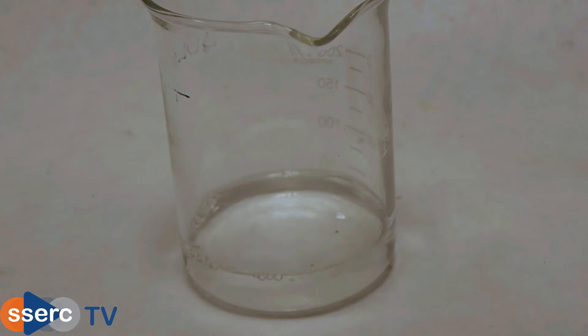Now add 8 grams of anhydrous sodium sulphate to your combined solutions. This will remove any traces of water that were mixed into the ethyl ethanoate. You will notice that the sodium sulphate clumps together in a mass at the bottom.